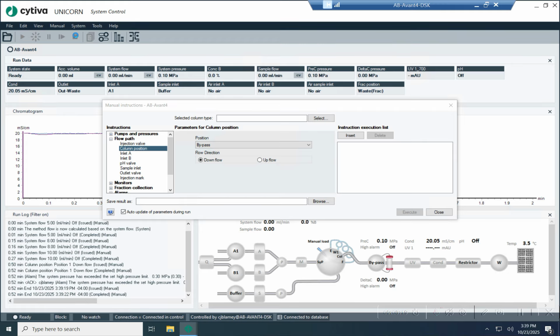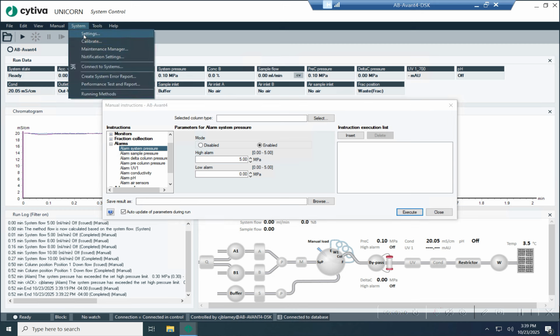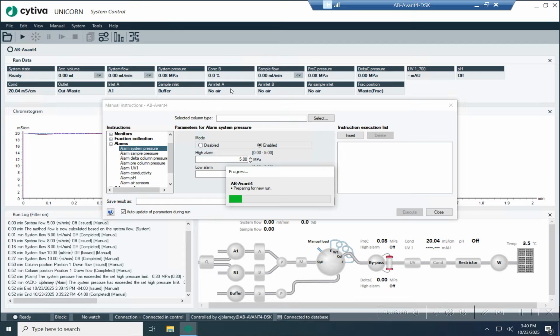Something really important that I wanted to show you was that, let's look at the alarm setting really fast here first. Then let's bring up the system pressure. So even though this is the default right here, whatever the default is, it's not shown here, whatever the alarm is. What's displayed here is whatever is available, right? So in my opinion, they should read this over and put it to what it currently is right here, but they don't. So you have to remember that you changed this system setting, or you at least have to go and check it. So I am going to change it back to what it was before, so I don't have to worry about this because I'm not going to be using 0.3 all the time.